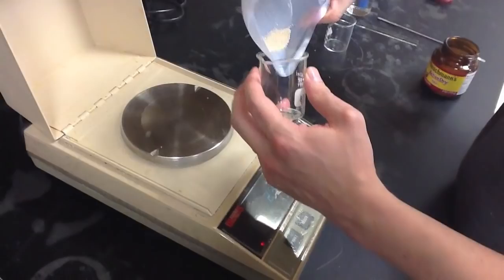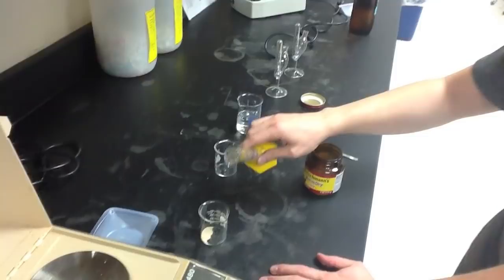Once we add the solution, we mix using a glass stir rod and allow this particular mixture to incubate at room temperature for five minutes.